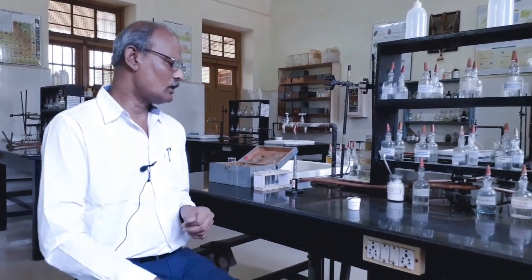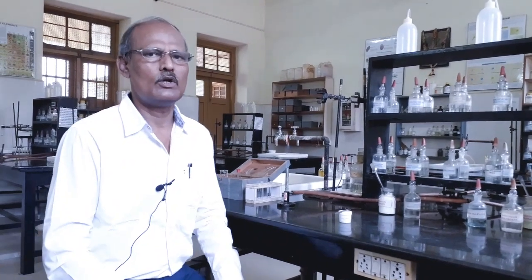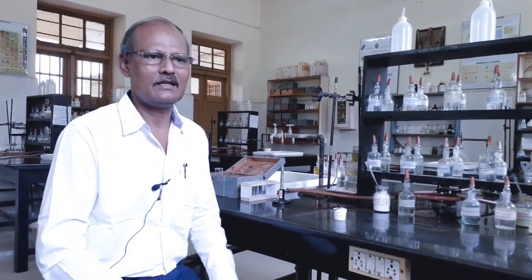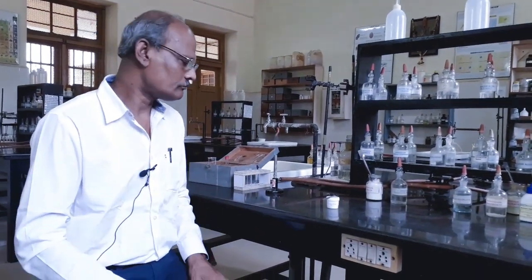Therefore, we carry out ammonium basic radical in the beginning only to make the analysis of basic radical easy. So, first I am going to demonstrate the identification, analysis of basic radical, then I am going to show you how to write procedure for the detected basic radical in order to make the analysis easy.